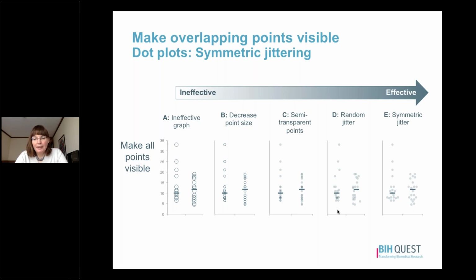And then our last strategy is something called symmetric jittering, where we spread points evenly to one side or the other of an imaginary line going through the center of the group. This is the most effective strategy because it fully eliminates the overlap and it allows us to clearly outline the shape of the data distribution with our eyes, as well as being able to see every data point so we get a better sense of the sample size.